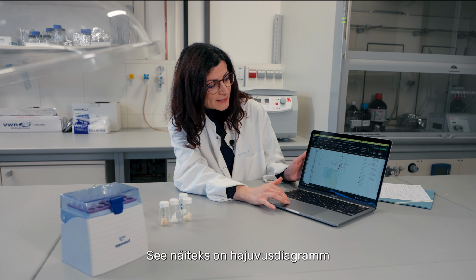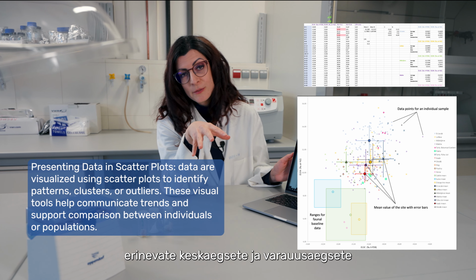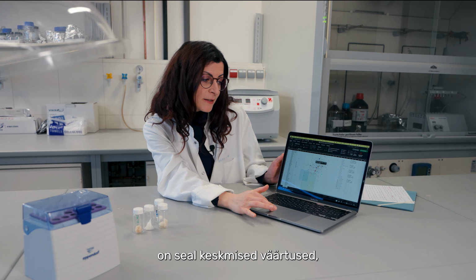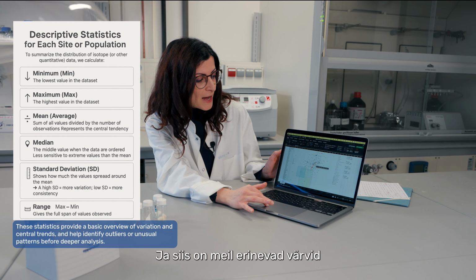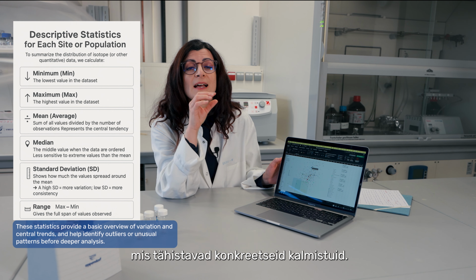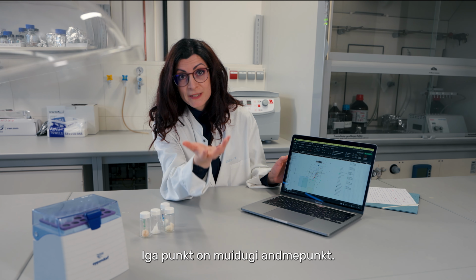This, for example, is a scatter plot of different populations from different medieval and early modern cemeteries from southern Estonia. And as you can see from here, there are the mean values that are represented by these crosses, and then we have the different colors and the different shapes of these points in the scatter plot that represent a particular cemetery. Each of the points is of course a data point.